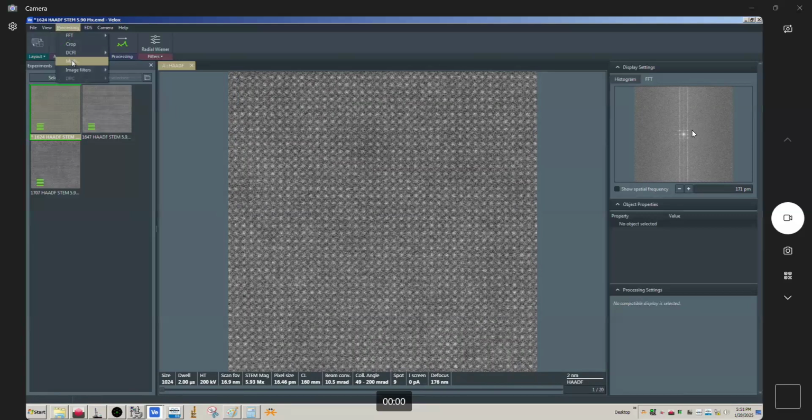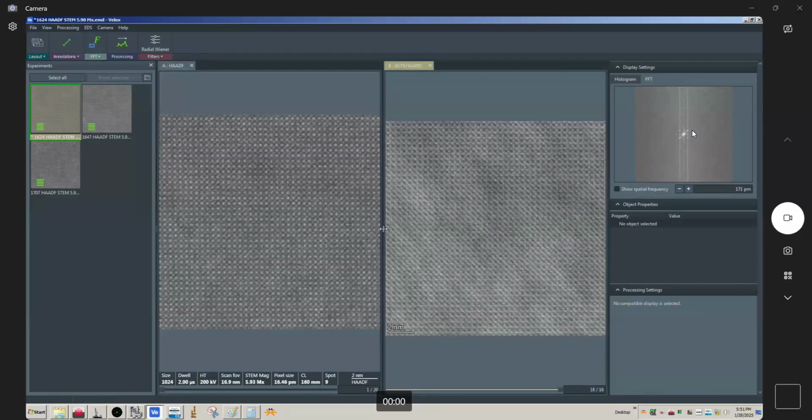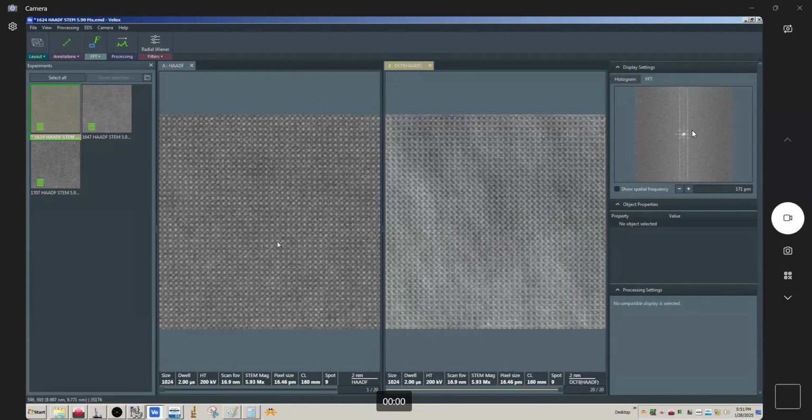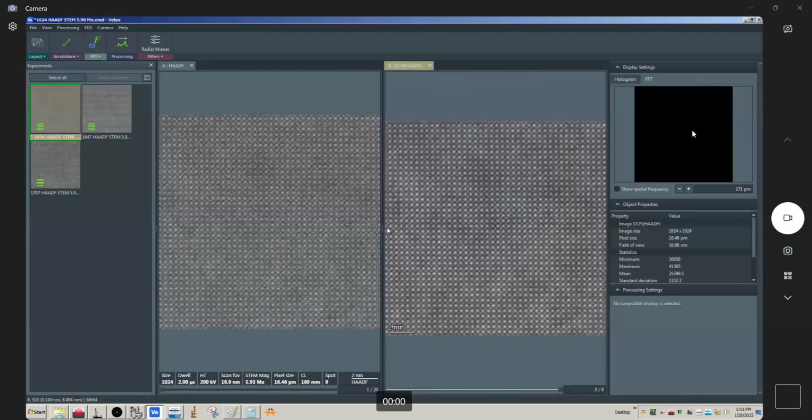So we'll go processing, DCFI. Obviously, we want to optimize for periodic images because that's exactly what we have here. If we just do regular DCFI, this won't work at all. Just to prove it, let me show you. All right, so you can see very clearly this didn't work at all. So you've got to use the periodic option with something like this. So let me go ahead and get rid of this, and we'll go processing, DCFI, optimize for periodic images.